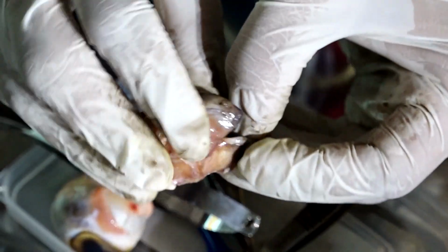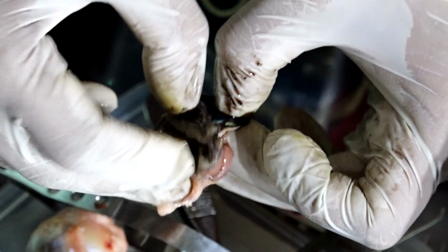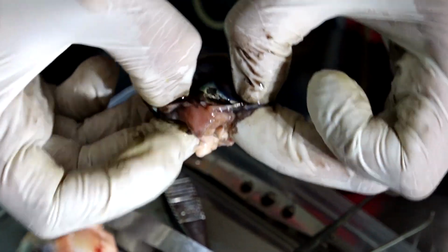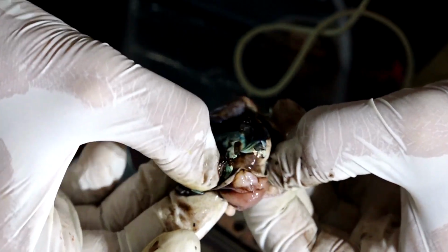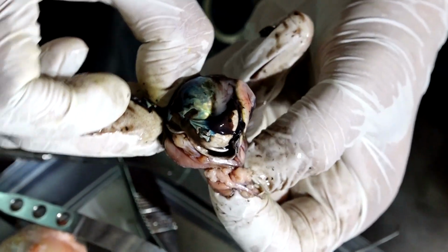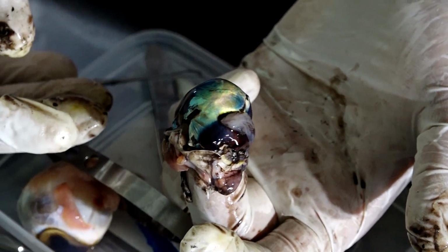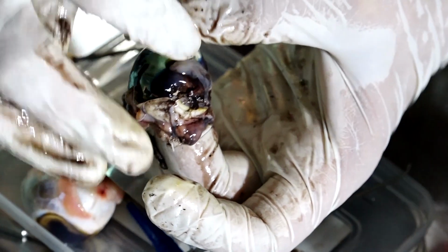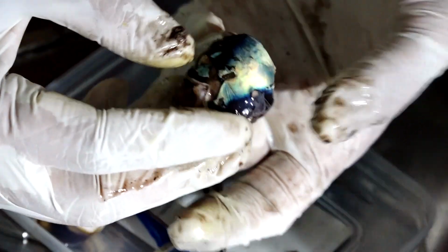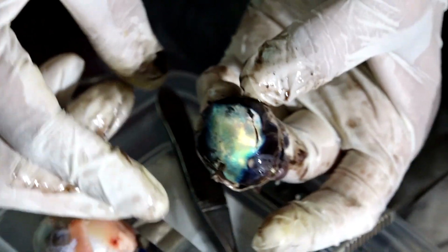Okay. So now I'll invert it and then you can see the retina. I'm inverting it completely. Can you see the glistening structure there? That is the retina. Because now there is no blood supply, you don't see it as a pink or orange structure, because there is no blood flow over here. So it's appearing like that. So you can see this is the whole retina. Can you see that?